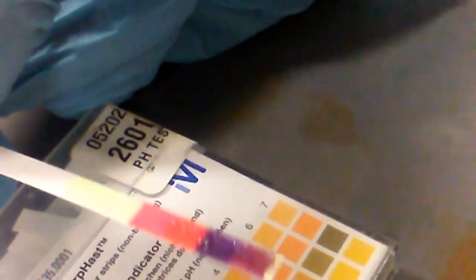So this could be 16 molar sulfuric acid, and it just seems like the reaction happens slowly, even with concentrated sulfuric acid. So at this point, we're going to assume it's 16 molar.